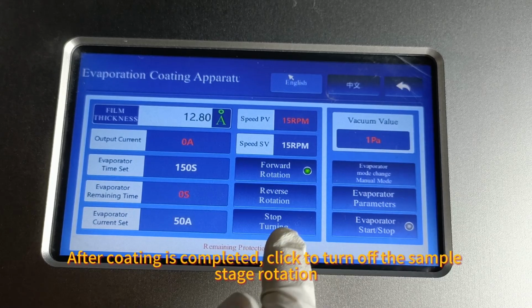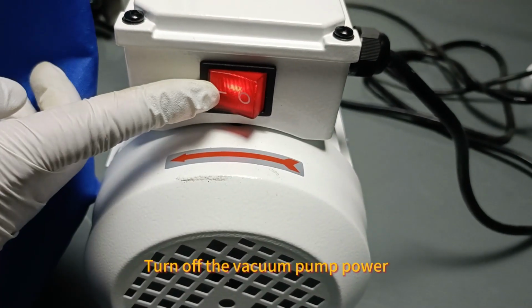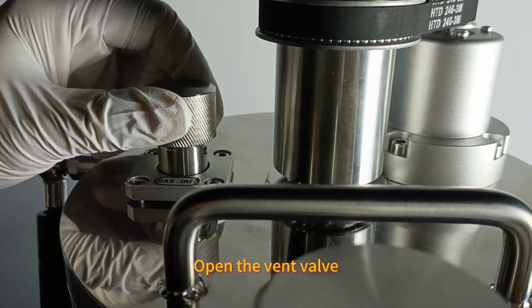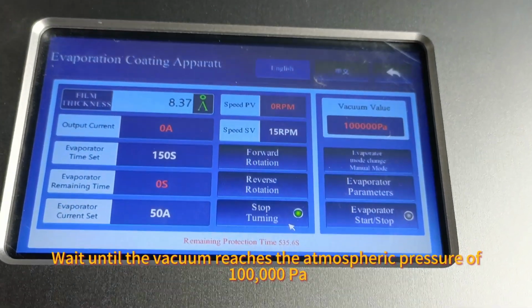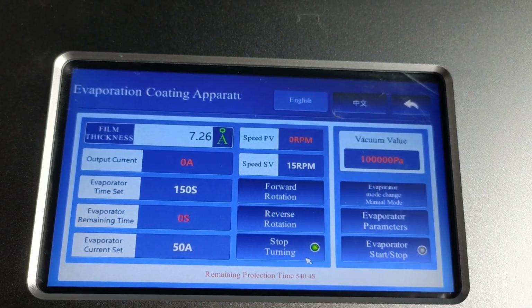After coating is completed, click to turn off the sample stage rotation. Turn off the vacuum pump power. Open the vent valve. Wait until the vacuum reaches atmospheric pressure of 100,000 Pa.